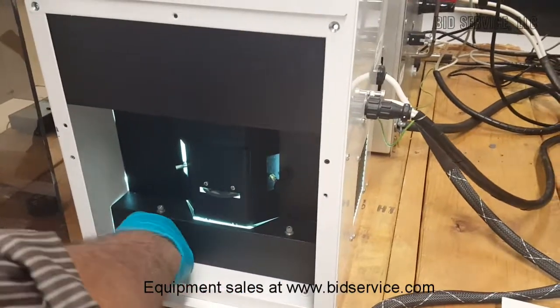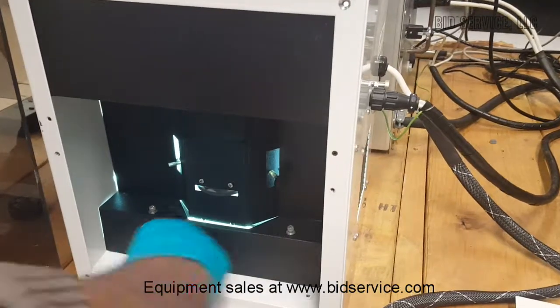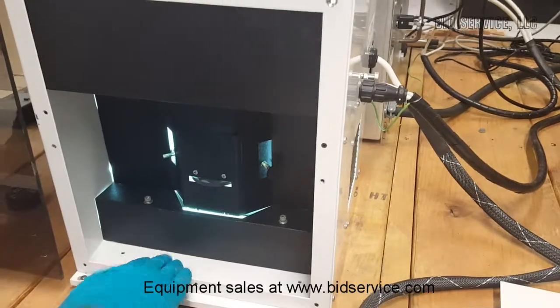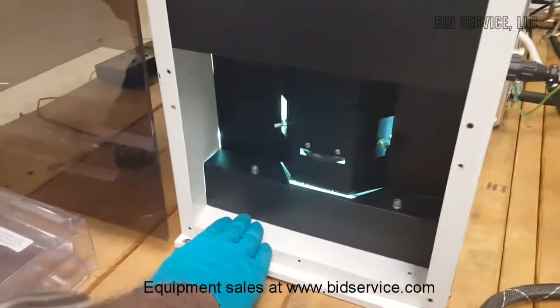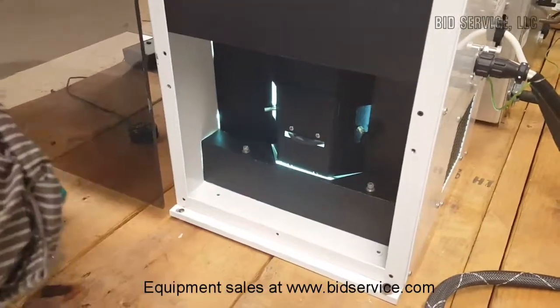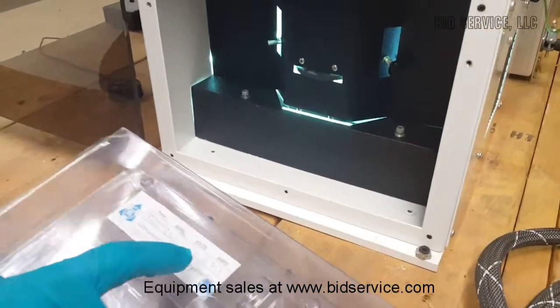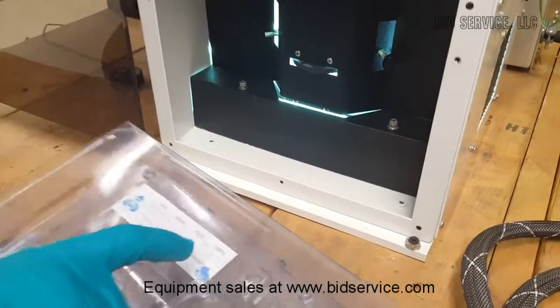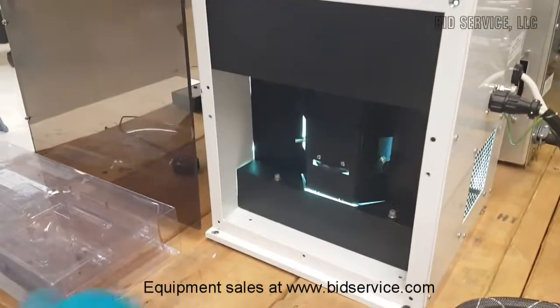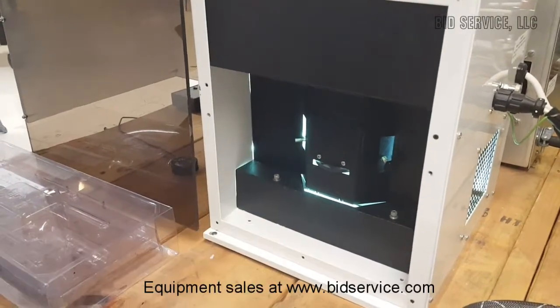Once the lamp energy is stabilized, you can see on the power meter for the lamp power that it will be stable, and the voltage will be of the order of 63 volts and the current about 31.7, or a little over 30 amperes. If you are running the lamp at less than 2000 watts, the current will drop a little bit.